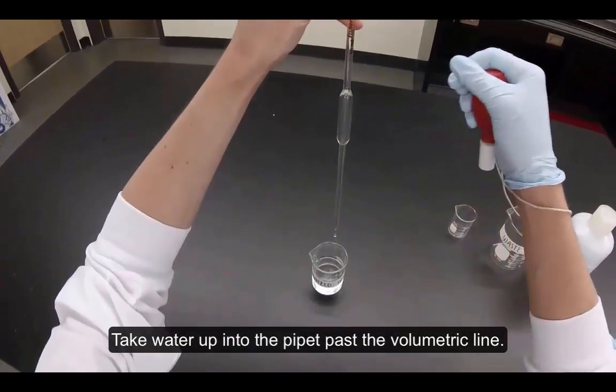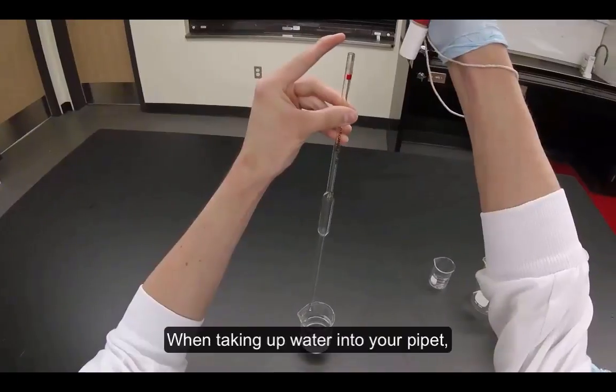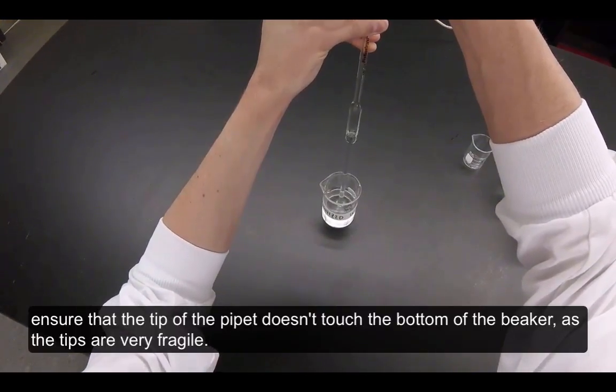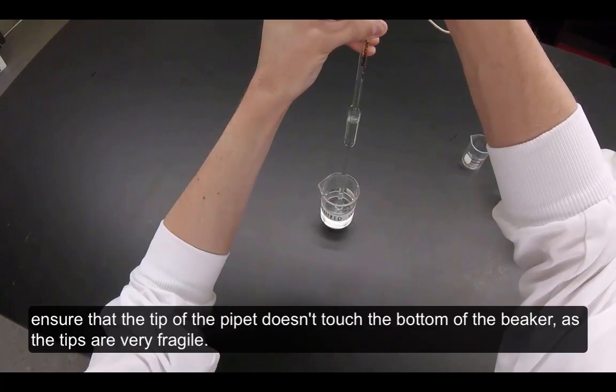Take water up into the pipette past the volumetric line. When taking up water into your pipette, ensure that the tip of the pipette doesn't touch the bottom of the beaker as the tips are very fragile.